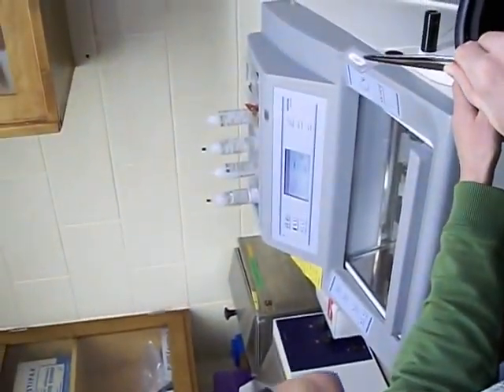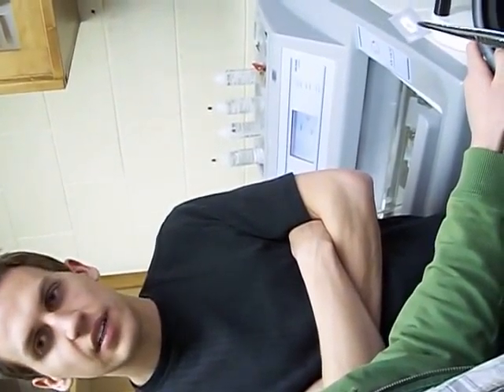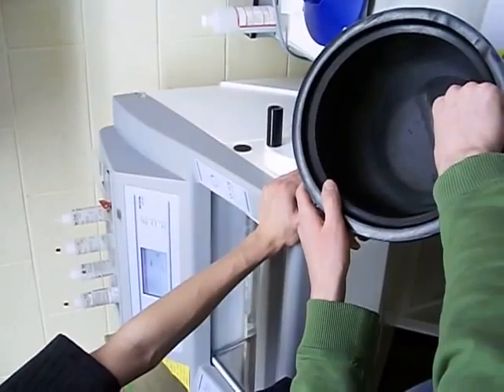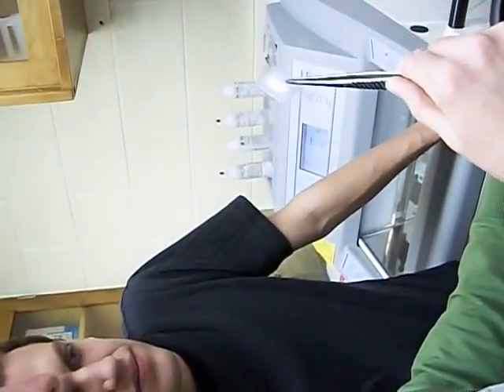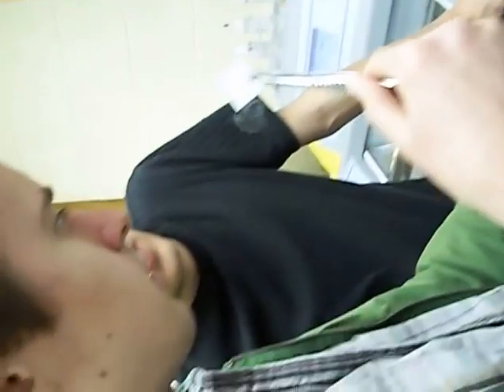And you'll notice it'll turn more and more white. So how long do you wait after seven seconds? Just until you can see it's kind of equilibrated. You'll see the nitrogen evaporate off the plate, and that's usually when I know that it's ready to go back in. And so that's got one, two, three, four, five. And if you look at it and you notice it's not completely frozen — like here, you can see that it's still a little transparent in the middle.